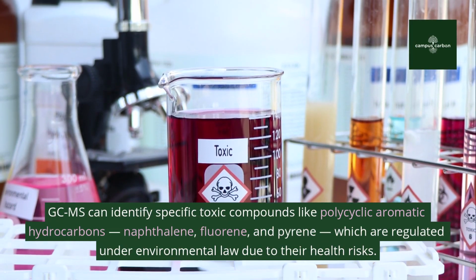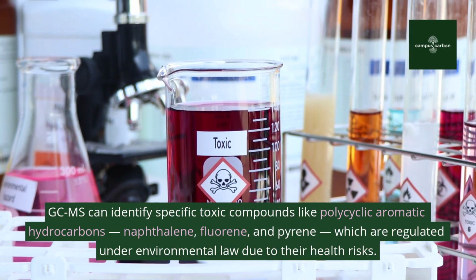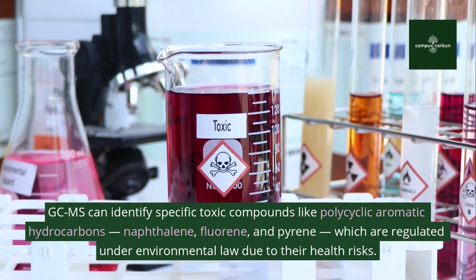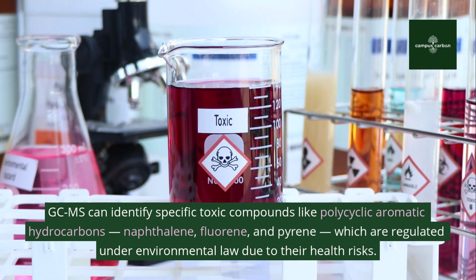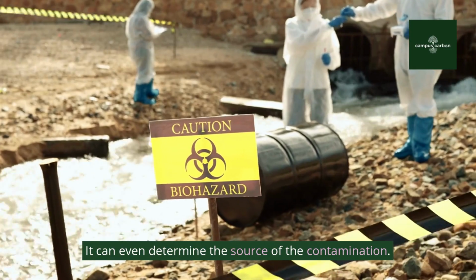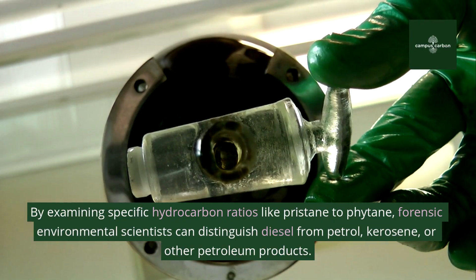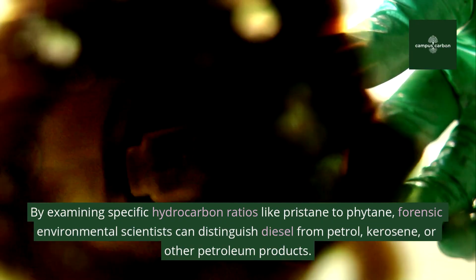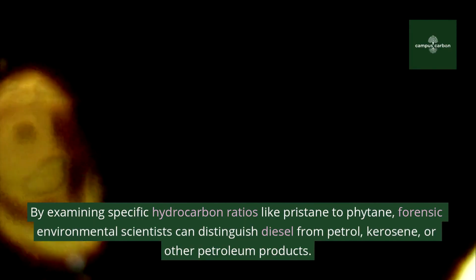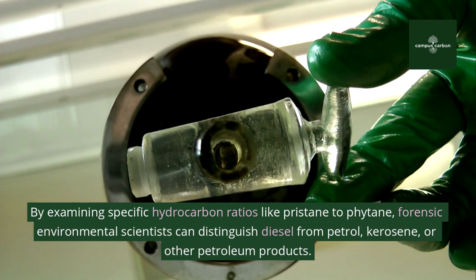GC-MS can identify specific toxic compounds like polycyclic aromatic hydrocarbons, naphthalene, fluorene, and pyrene, which are regulated under environmental law due to their health risks. It can even determine the source of the contamination. By examining specific hydrocarbon ratios like pristane to phytane, forensic environmental scientists can distinguish diesel from petrol, kerosene, or other petroleum products.